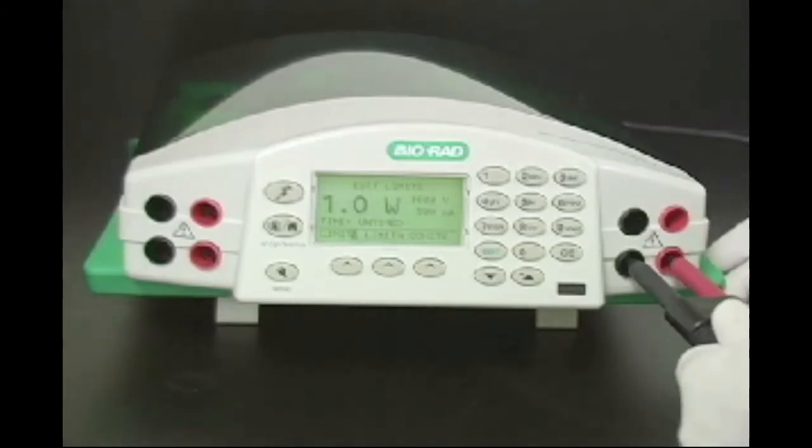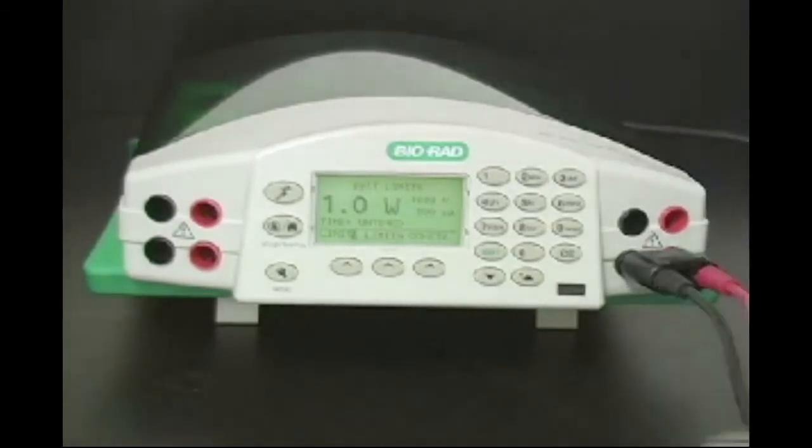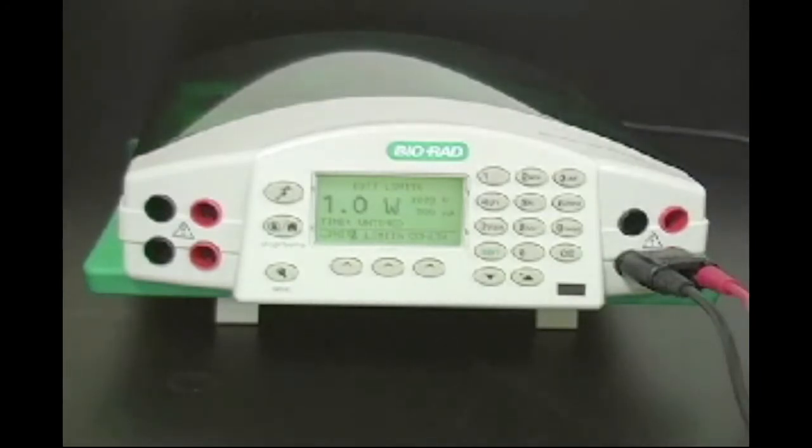Attach the leads from the lid. Start the run.